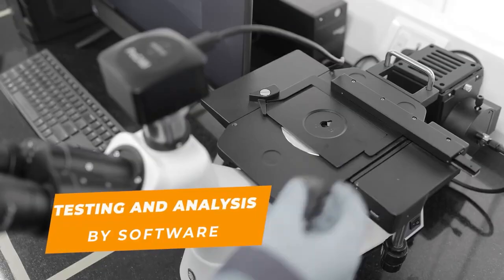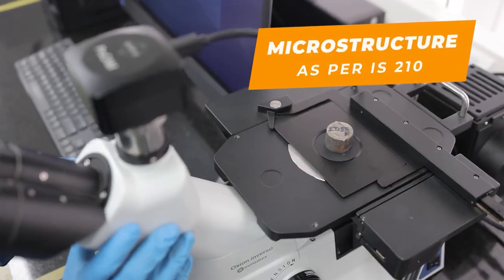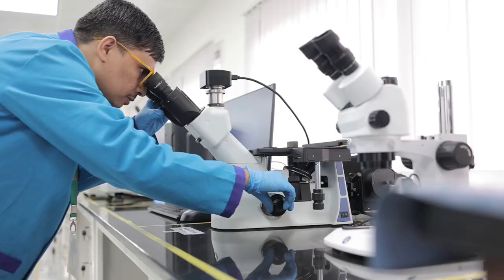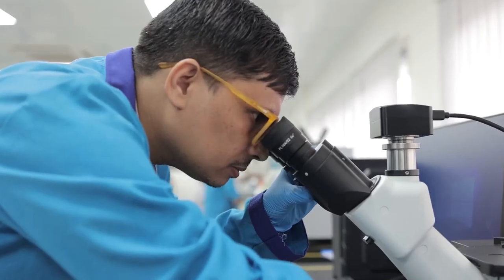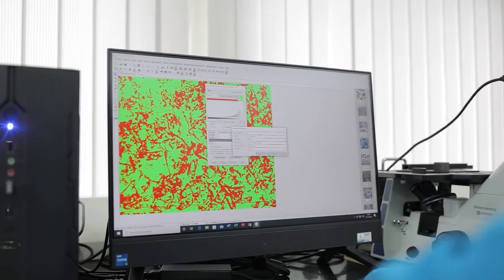After preparing the sample, it is positioned on the viewing platform of an inverted metallurgical microscope. The magnification is adjusted to obtain a clear image of the microstructure. The microscope's built-in camera captures the microstructure image, which is analyzed using specialized software on a desktop.